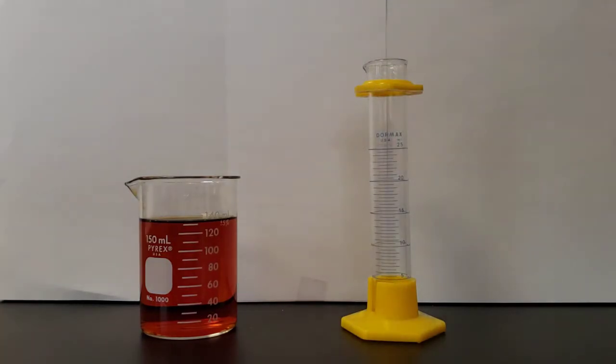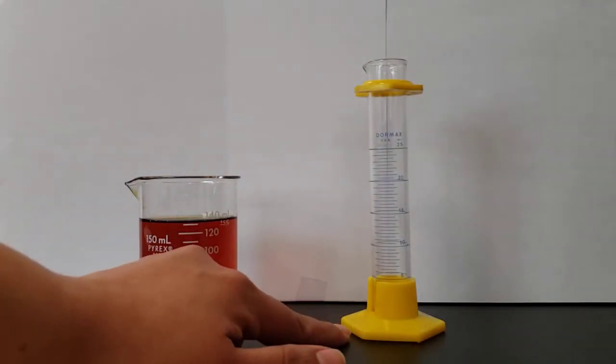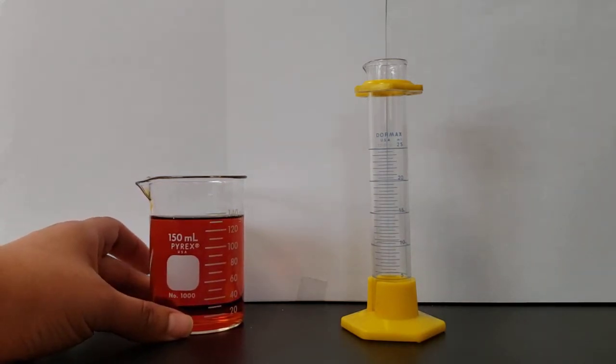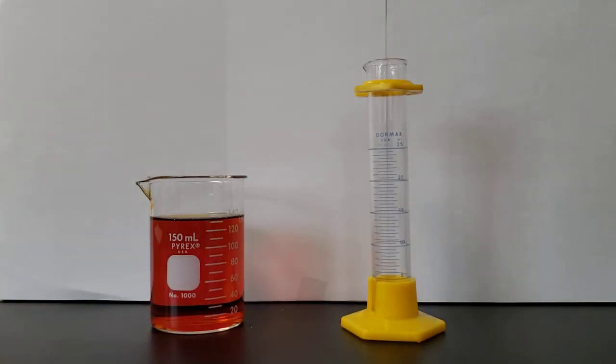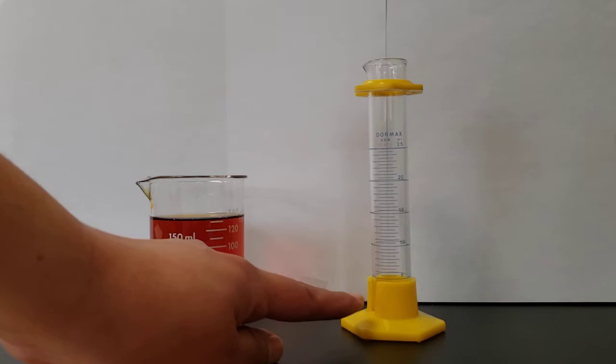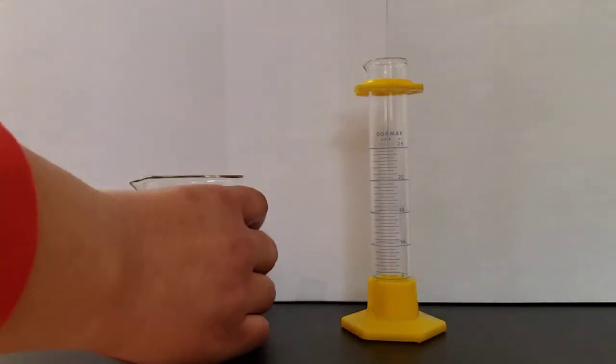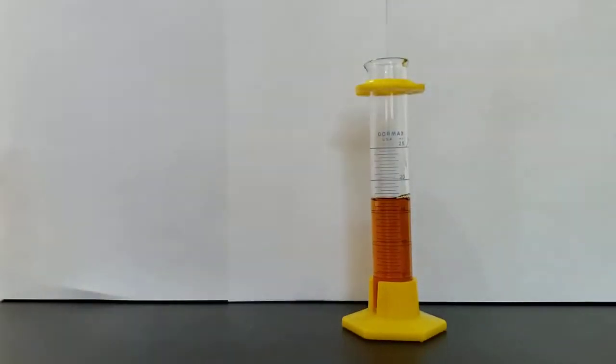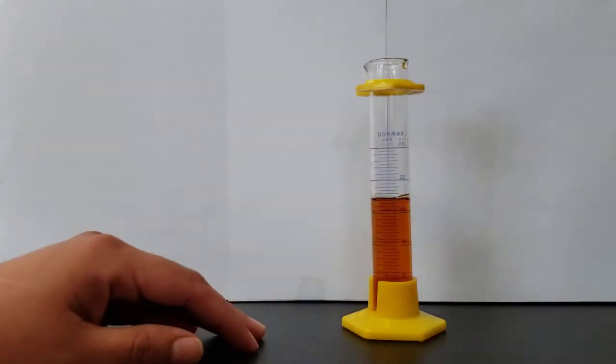So here we look at our materials. We have a graduated cylinder and we have a beaker full of liquid. And this liquid is just water with a little bit of coloring in solution so that it is easier to read the liquid volume. According to our instructions, we want to fill this bad boy up about a third of the way full. The exact amount doesn't matter. We are just pouring some liquid in here so that we can get some practice measuring that liquid volume. So I'm going to pour some liquid in here up top, roughly up to one third. And here we have it.